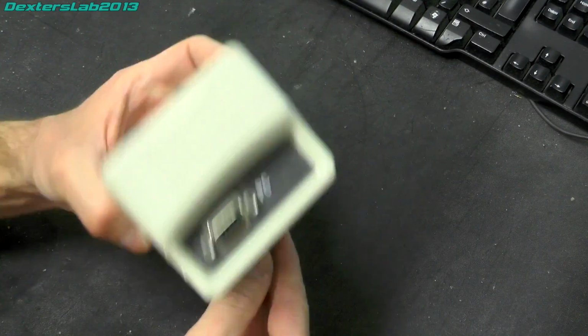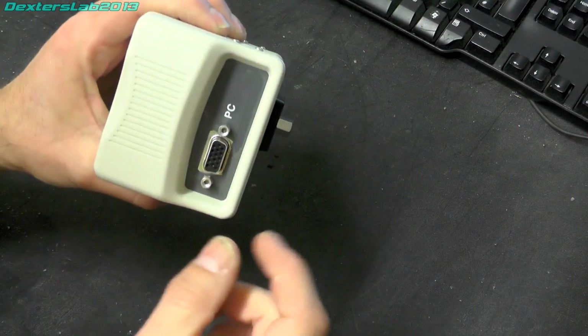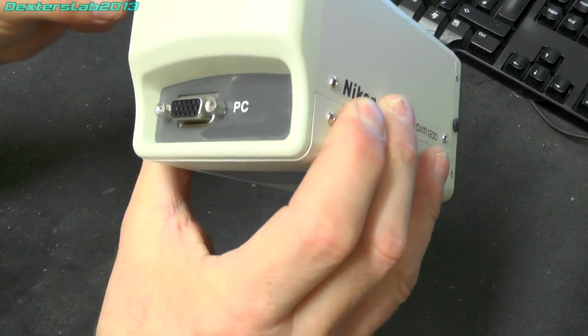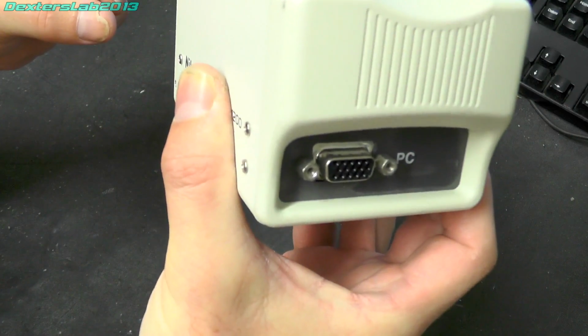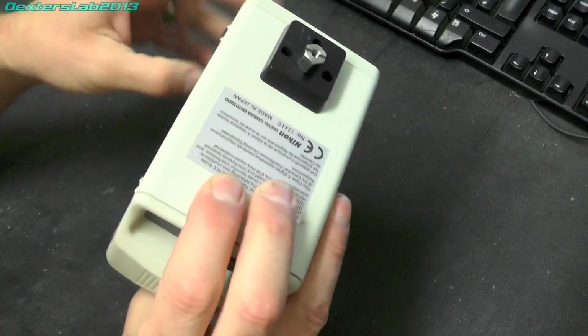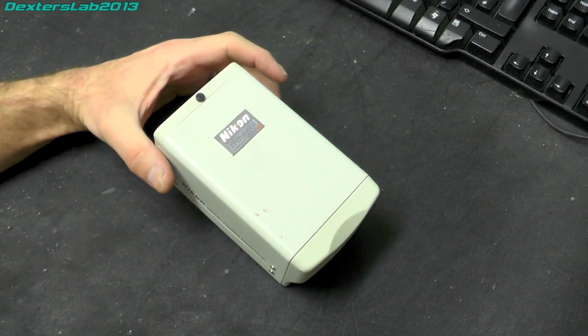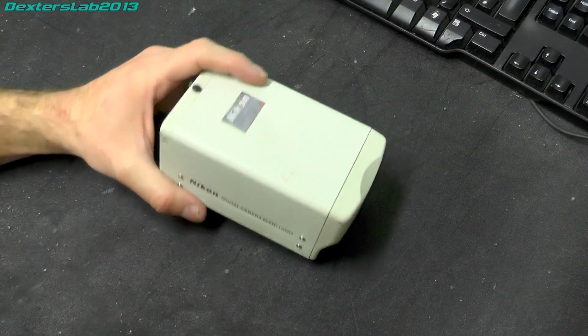Right, so before we open this up, we've got obviously the C-mount on the front, we've got a tripod mount on the bottom, and we've got the connection that went over to the PC. That is just a standard 15-way connector there, which would have had a cable over to the interface card, and that is it. There's nothing really else on it, so let's get a screwdriver.